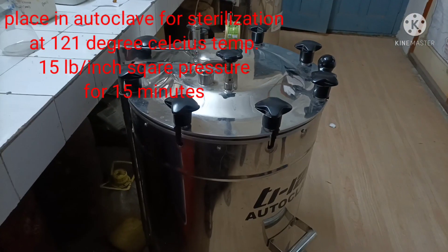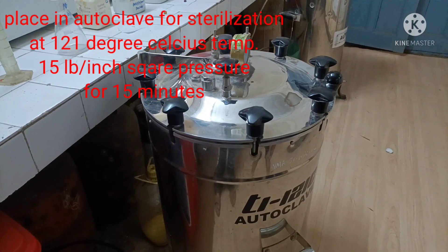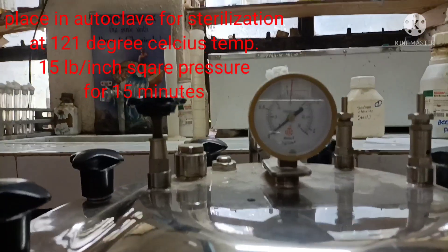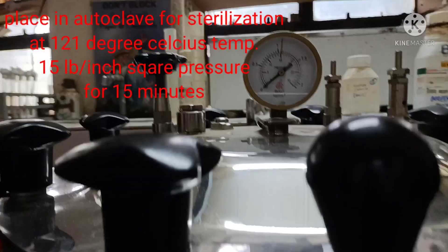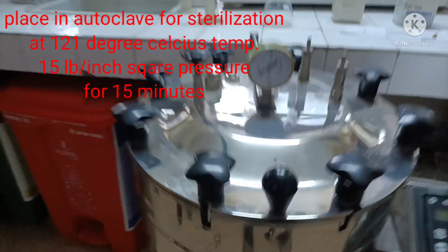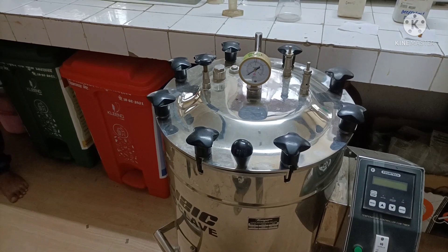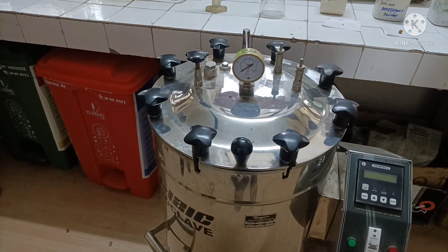The autoclave is the instrument used for sterilization. We keep the culture medium in the autoclave at 121°C, 15 lbs pressure for 15 minutes for proper sterilization. After the holding period, we remove the culture medium, cool it, and dispense it into tubes or flasks according to our requirement.